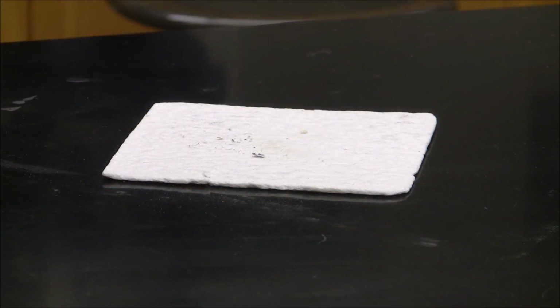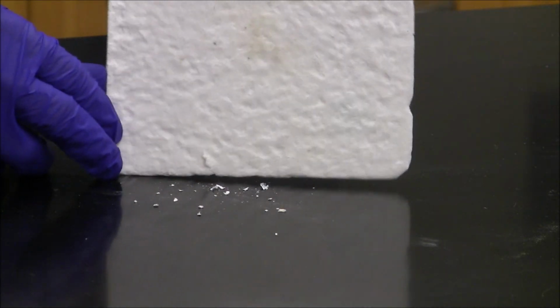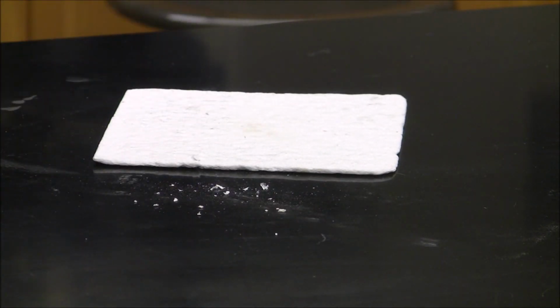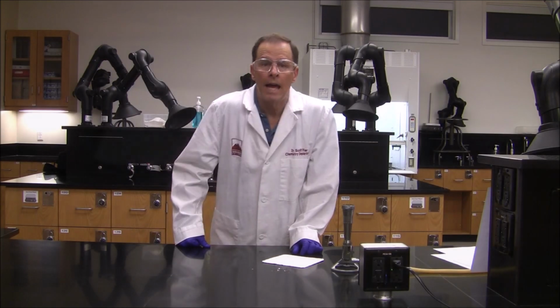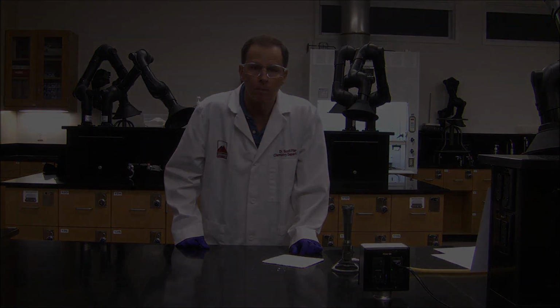I probably should have told you, but make sure you do not look directly at magnesium when it is burning. The product of the chemical reaction can be seen here, a white ash. Enter your observations for the chemical reaction in your data table.